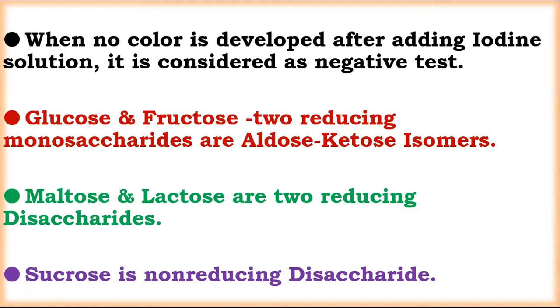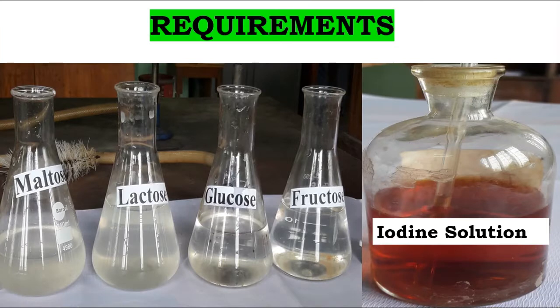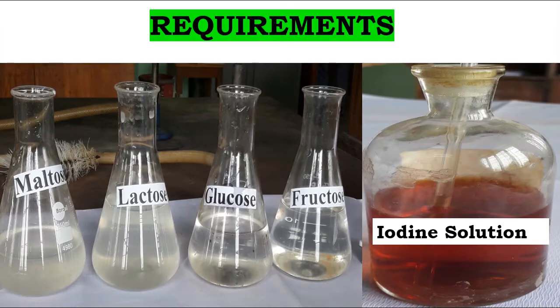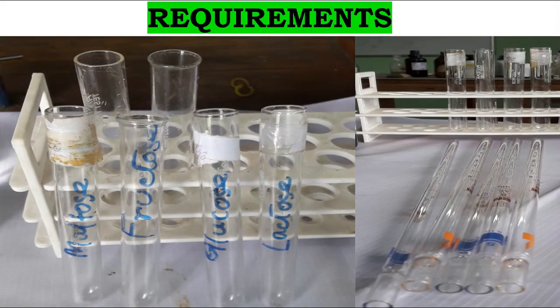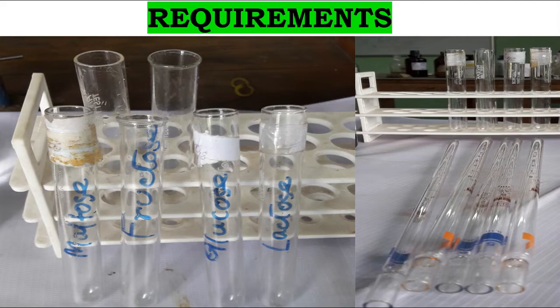Now let's see the requirements: maltose, lactose, glucose, fructose solution, and iodine solution. Also required are clean dry test tubes, a test tube stand, and graduated pipettes. Now let's see the test.